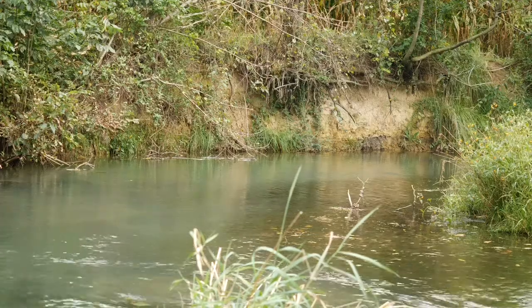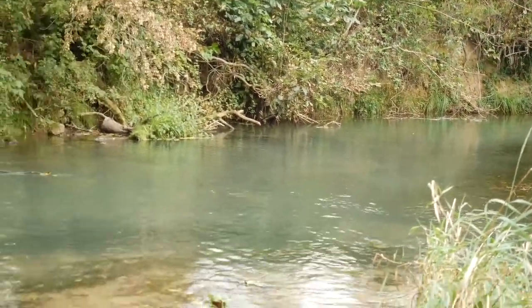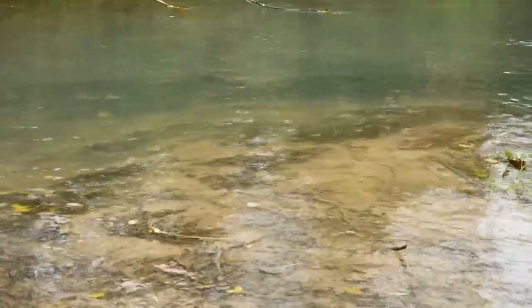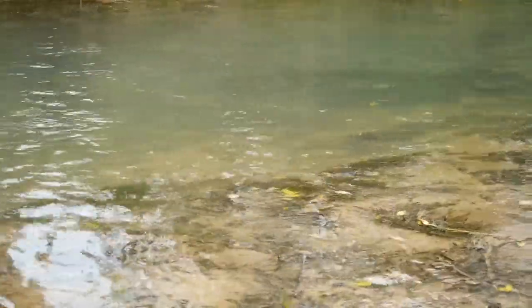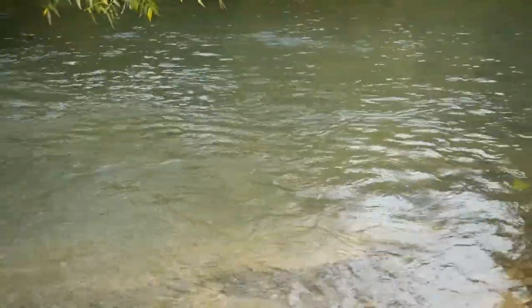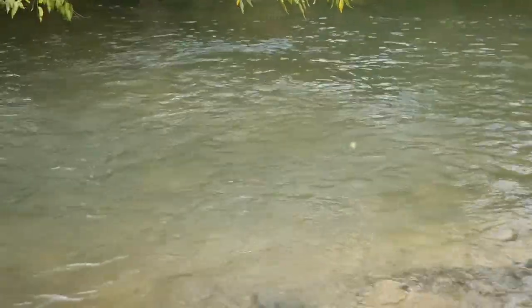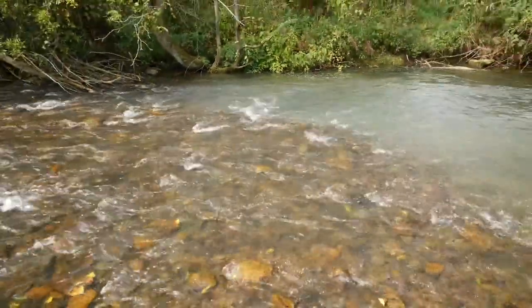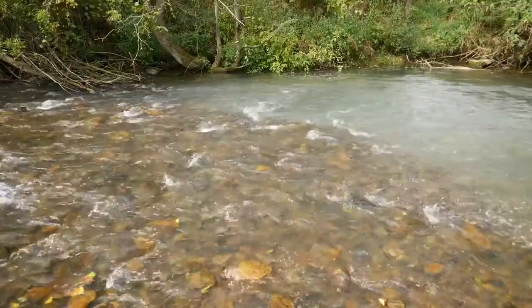So in addition to that bank, that erosion has led to the buildup in the stream of significant amounts of sand and sediment and silt. So we have a silt bottom here in the pool section, whereas as we get over here to the riffle section, we have the cobblestone pebble bottom similar to what we saw above. So we'll take the dissolved oxygen measurements at a couple of the locations throughout this pool to see how the oxygen varies within this pool itself.